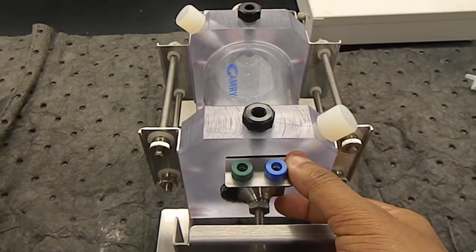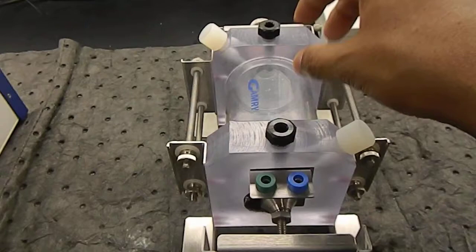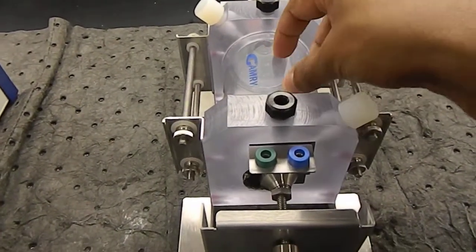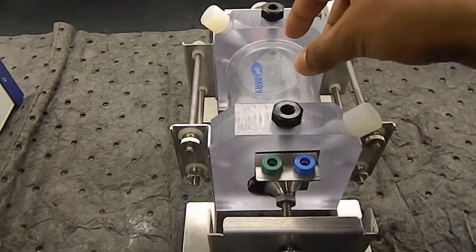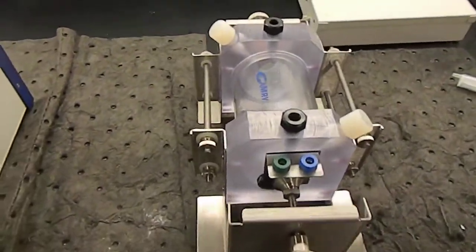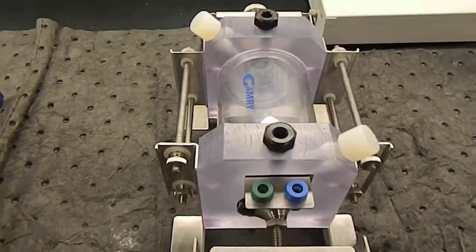So it is going to be inside the human body and react with our body fluid. That's what we try to do in the GAMRY work, so we used PBS solution for that purpose. So you have to know well what corrosion liquid you actually need.